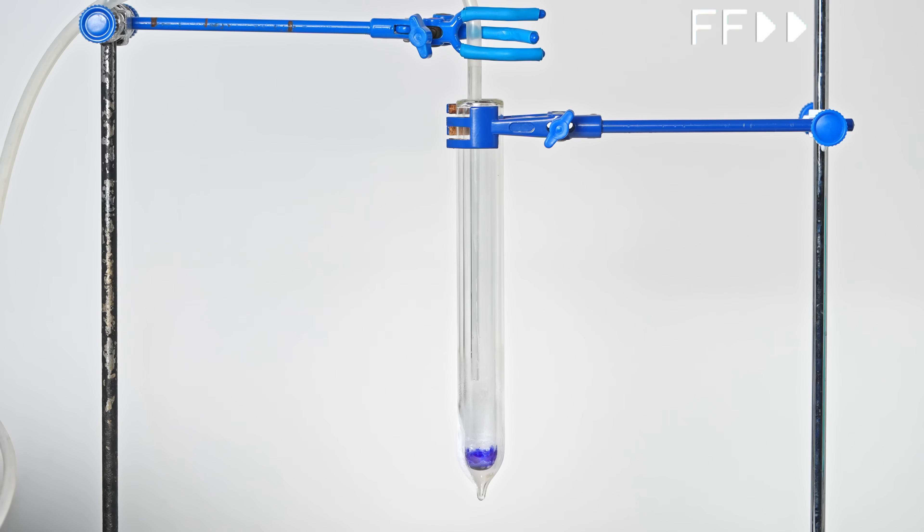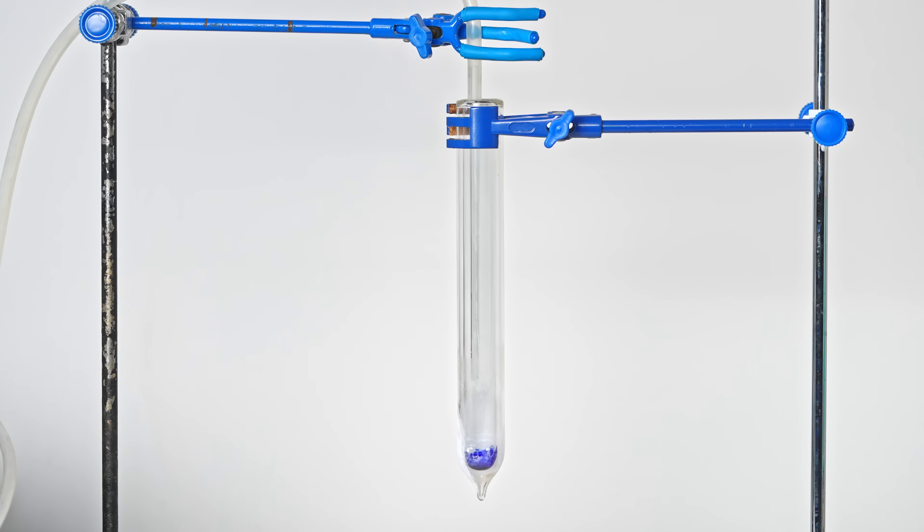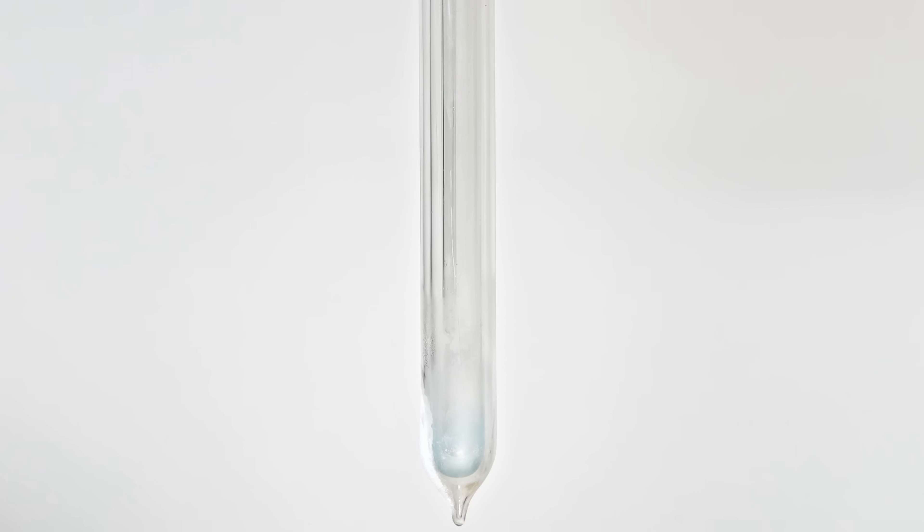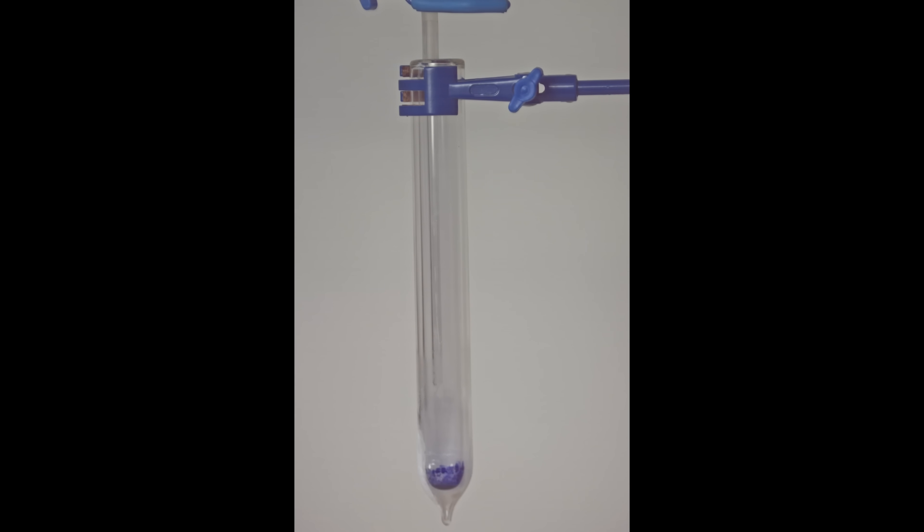Now that almost all the liquid ozone has evaporated, and a large amount of gaseous ozone has accumulated in the test tube, I allowed nitrogen monoxide as I did in the previous experiment. Great, this time we saw a bright flash, followed by the formation of reddish-brown nitrogen dioxide.